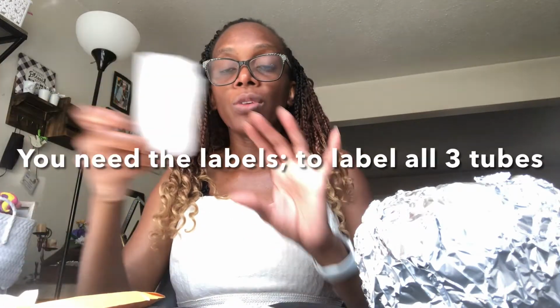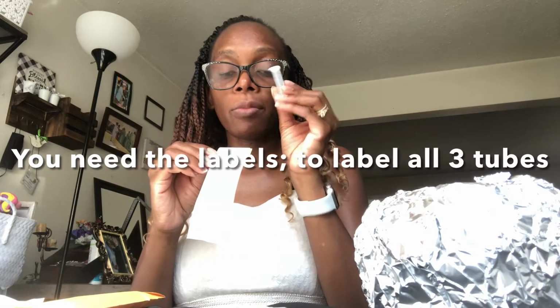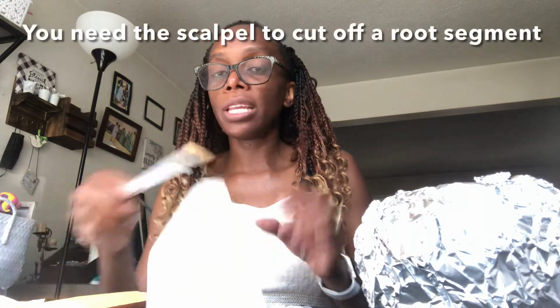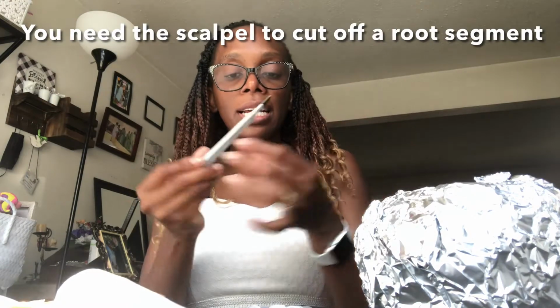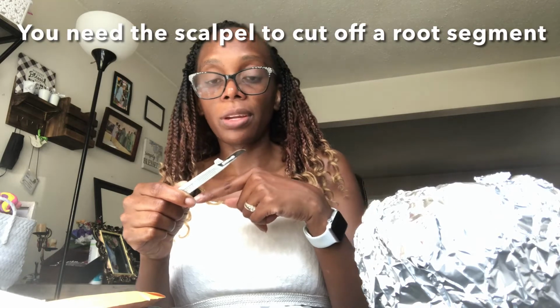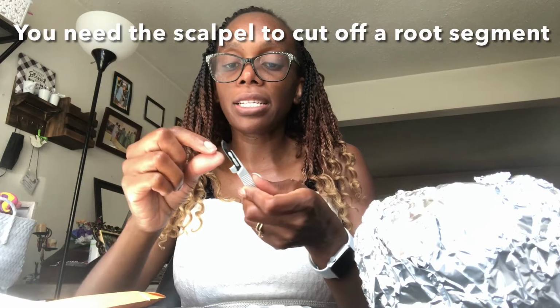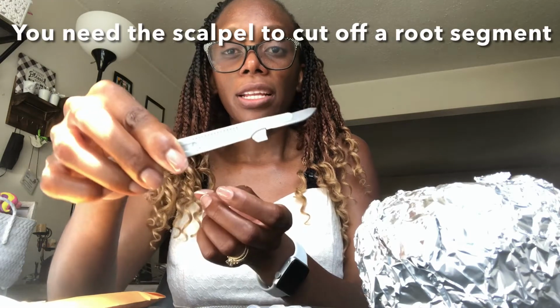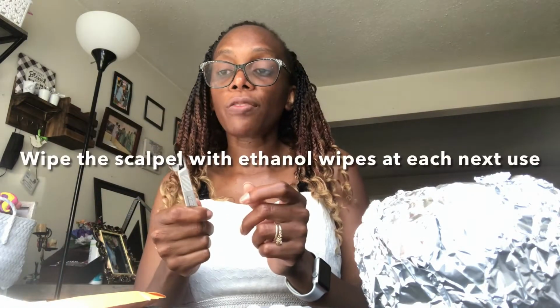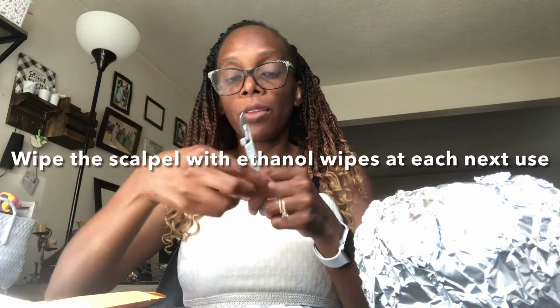We have that, and then you need labels. So today we'll label all three, so we keep track of what these are. And then you will need a scalpel. This one comes sealed. I unsealed mine yesterday when we started doing an experiment, and so if yours is still sealed, take it out of the package, and then take off the plastic clip so that the blade is exposed. Okay, and once you use it for the first time, the next time you use it, please use your wipes to wipe the whole scalpel.